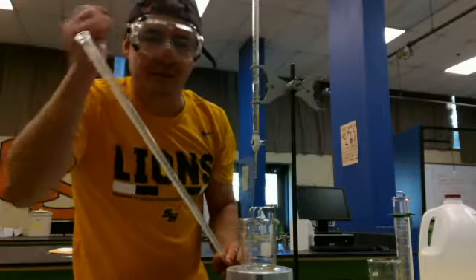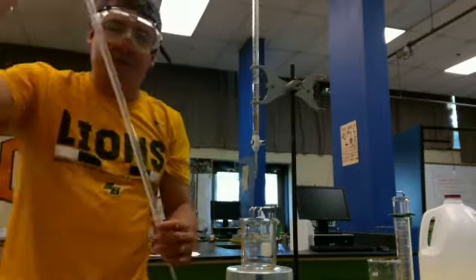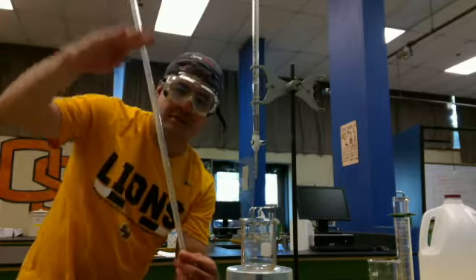And up at the top, it's weird to have that at the top, but that's zero. And the reason we mark from the top and go down, if you have liquid in here and it drops from, say, zero to 25, you know you've used 25.